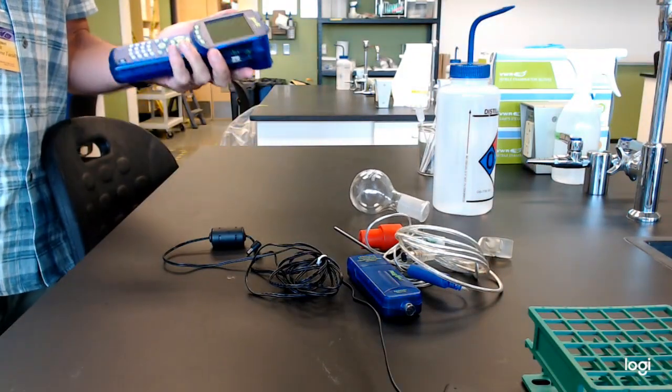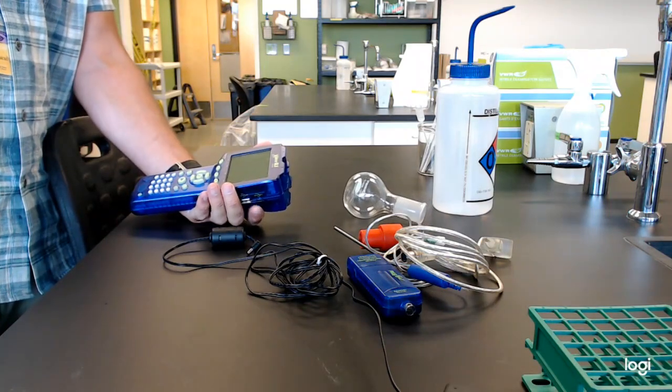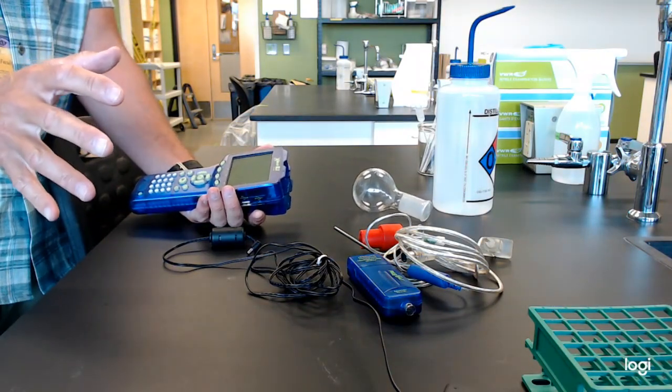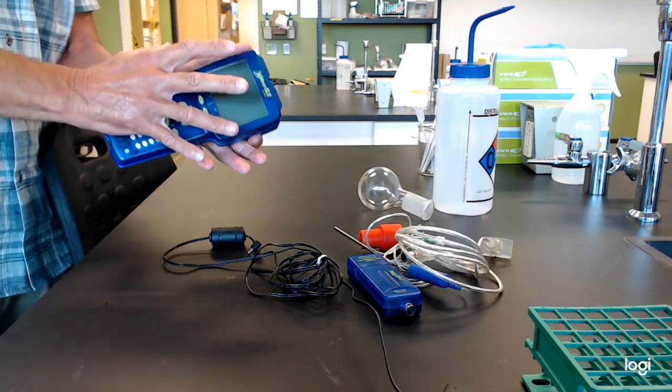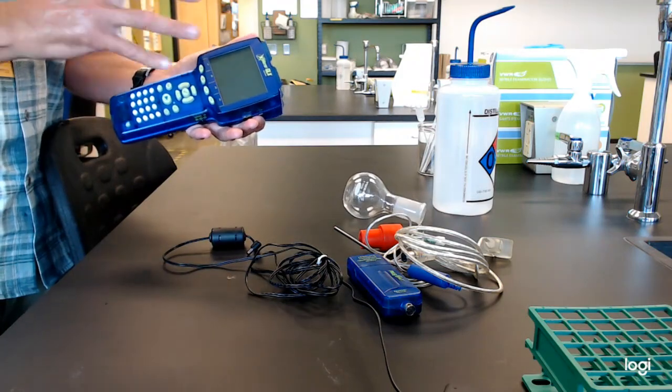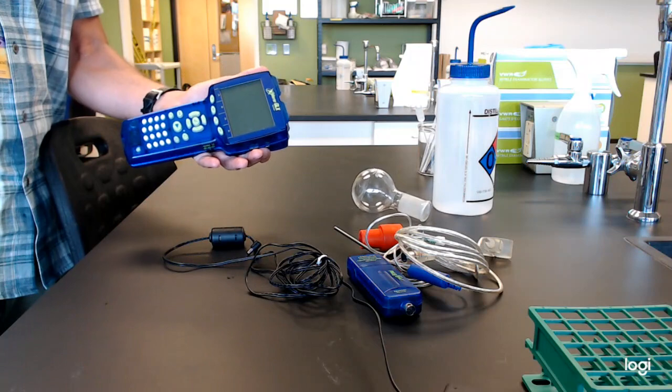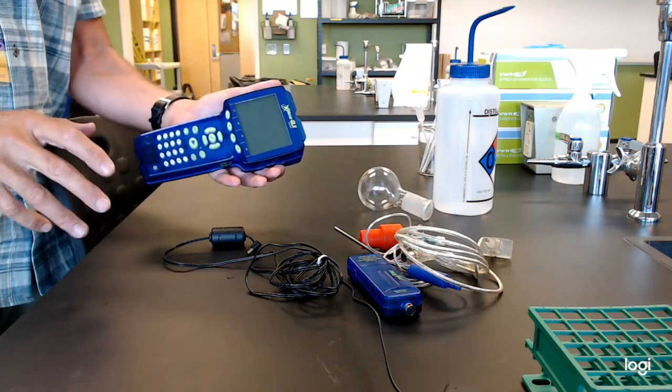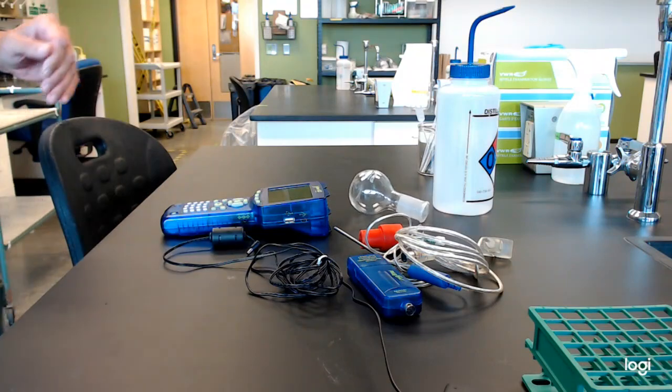I want to walk you guys through using this PASCO, and generally what I'm going to show you applies to all the sensors. First off, you need to realize that this is a data logger. It will store the data on there, but you'll have to transfer it back onto a computer if you want to work it up into Excel or anything.